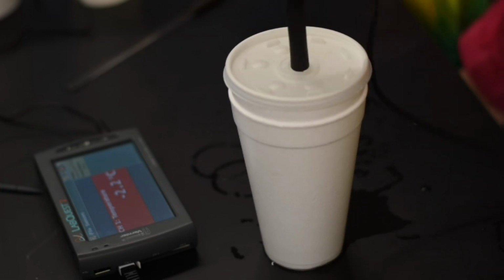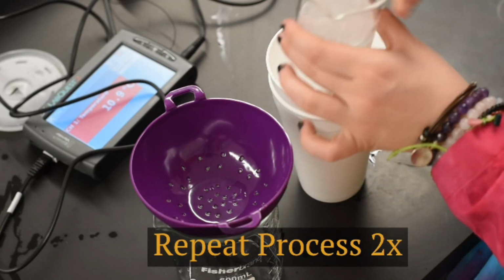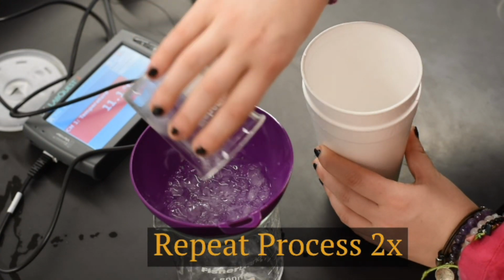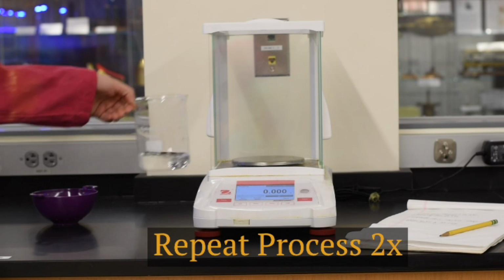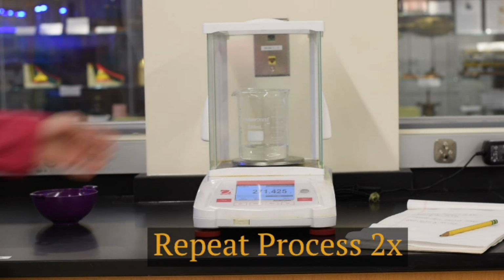You're going to stir it just like you did before. And you're going to repeat that process 2 more times, just like you did before. And then you're going to strain the ice into a pre-weighed 600 milliliter beaker and reweigh it at the end.